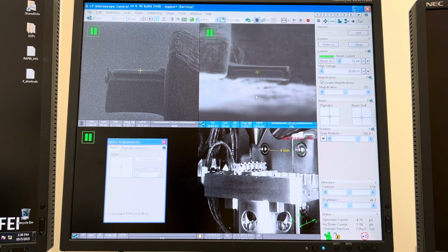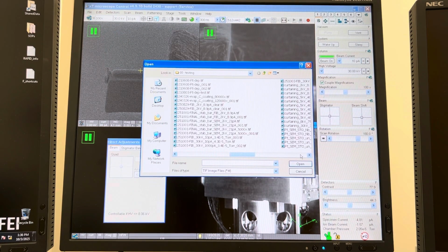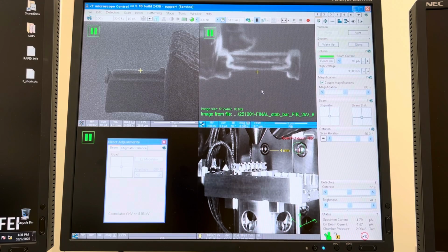So, let me show you this image here. I actually took this yesterday. I'm going to put this up on another video, by the way. But let me show you, where is it? Here it is. Okay, so this is 2 kilovolts and 8.9 picoamps, okay? But this was when the vacuum was in the high -7 torr range. So you can see how good that looks for 2 kilovolts.